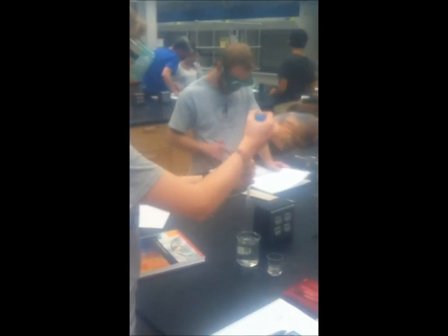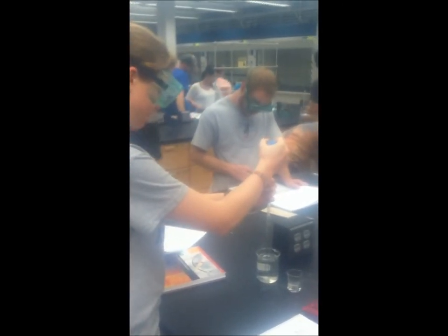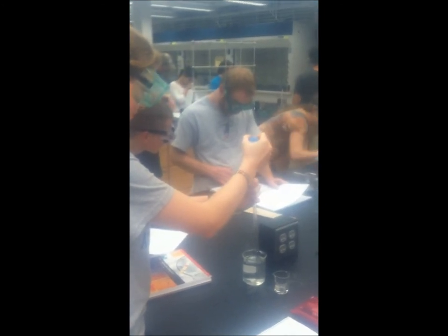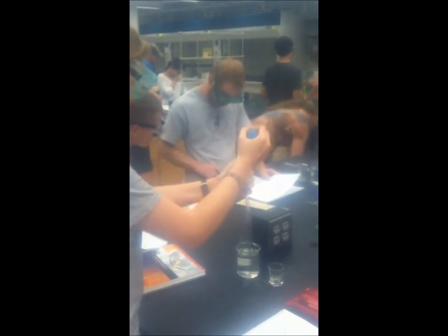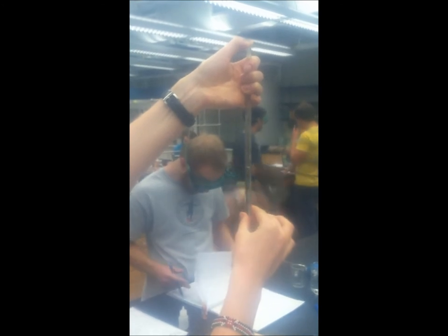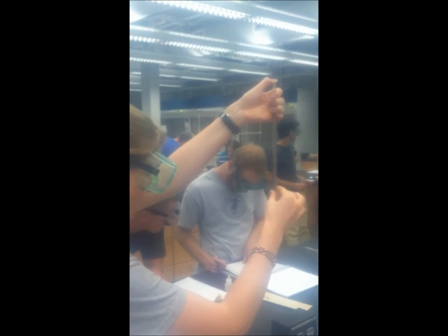You should try to name the steps that Sarah is going to perform. You should have named the steps as followed. Step 1: Draw water from the beaker with the pipette. Step 2: Get your measurement of the volume from the bottom of the meniscus and record it in the initial volume spot.